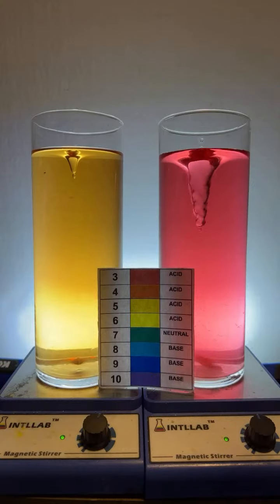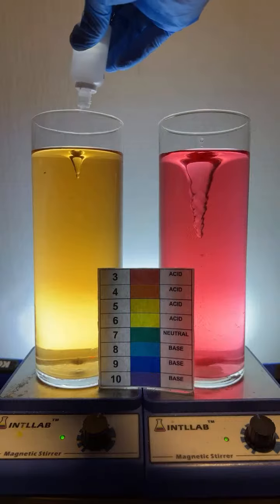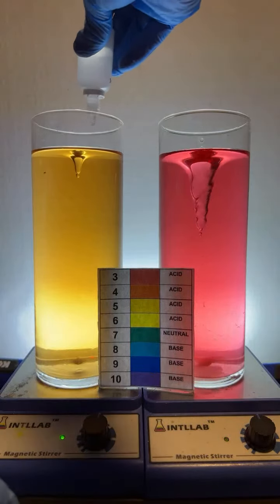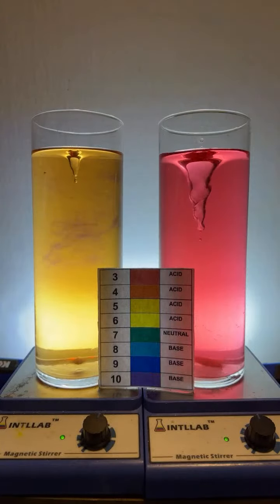Try to make number 1 green and number 2 orange. Here we go, number 1 green. Let's give it a shot. To get it to green, I'm at pH 5. I'm going to add base to increase the pH. So I'm going to add one drop and see what happens. Thank you there, Truck Spotting.